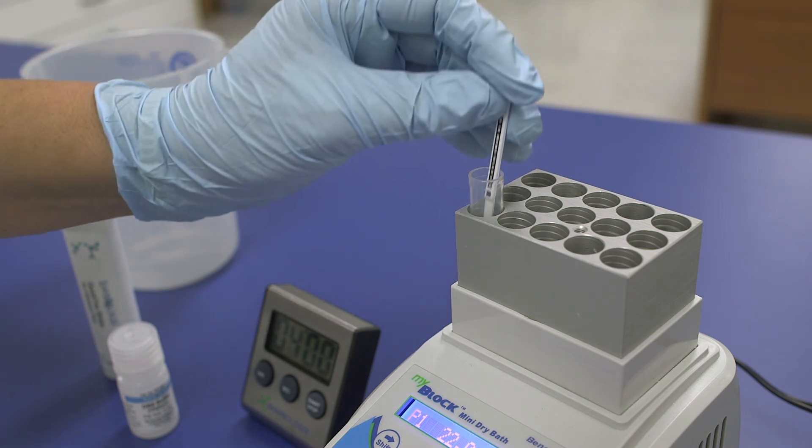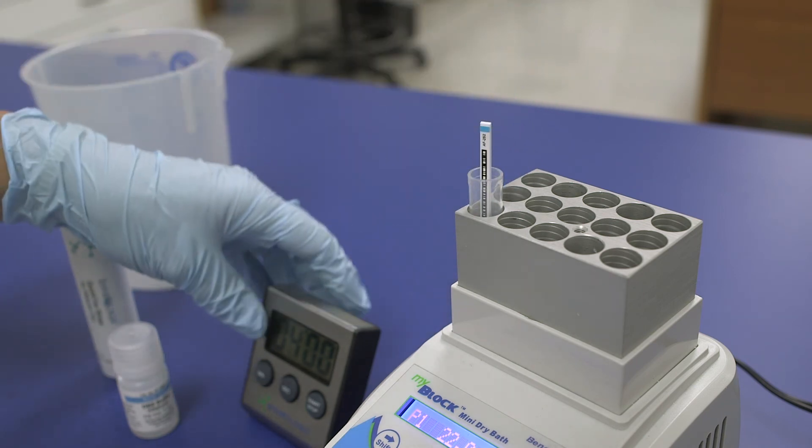Step 4. Add a new test strip and allow to react for 4 minutes.